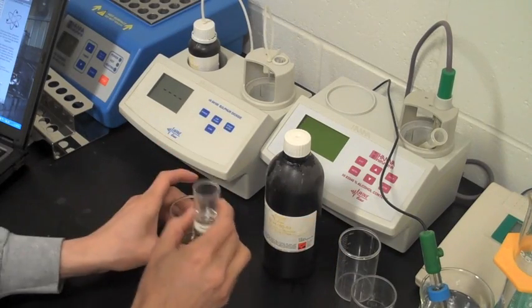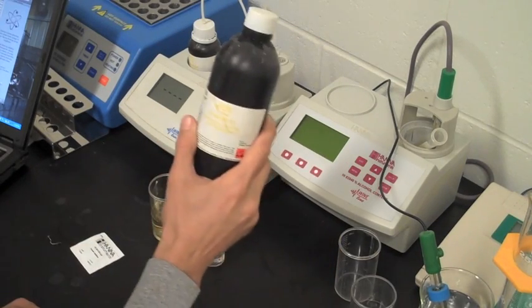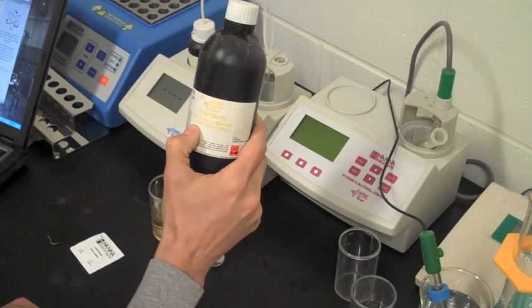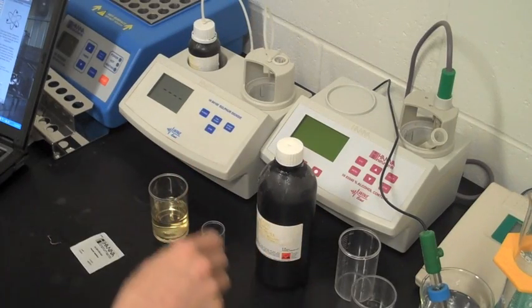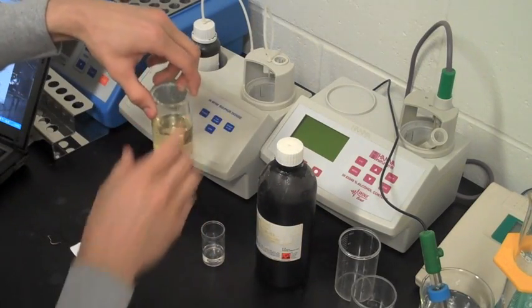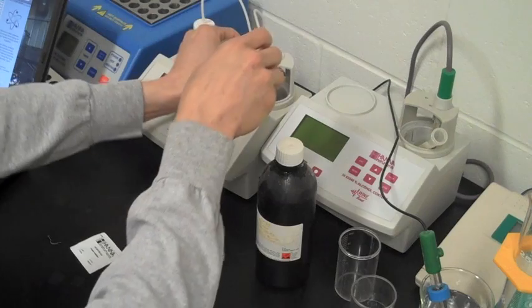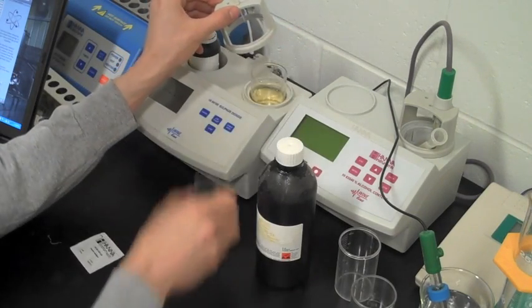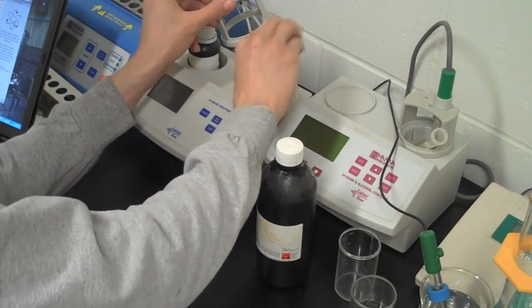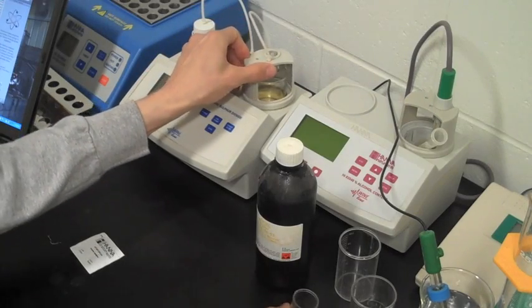What I have here is 5 milliliters of this free sulfur dioxide acid reagent and then 50 milliliters of wine. What you do here is take this, put your wine in here, put that in there.